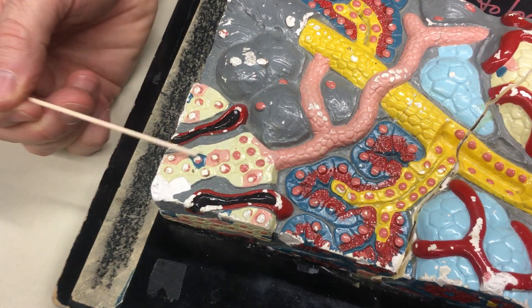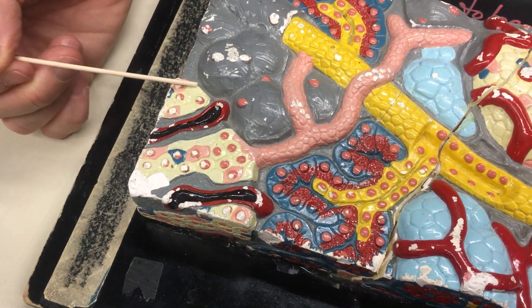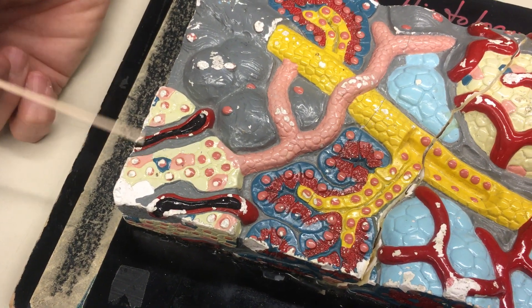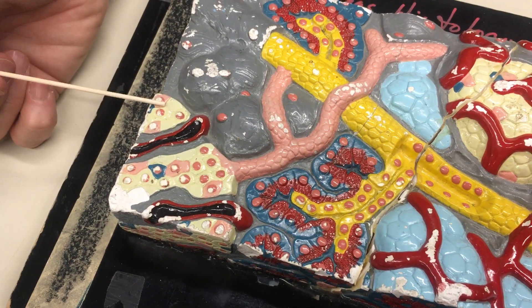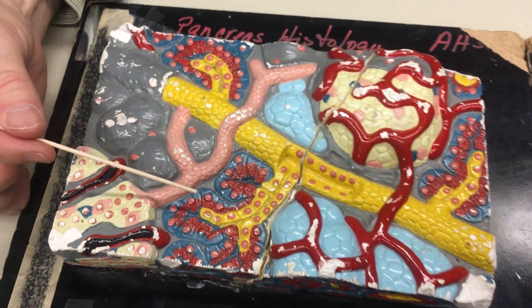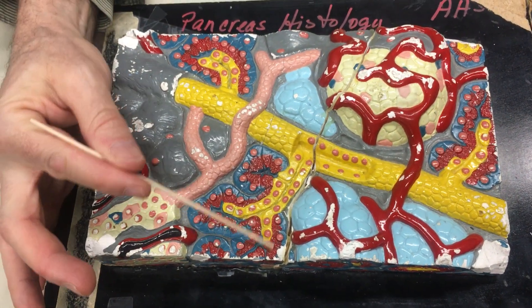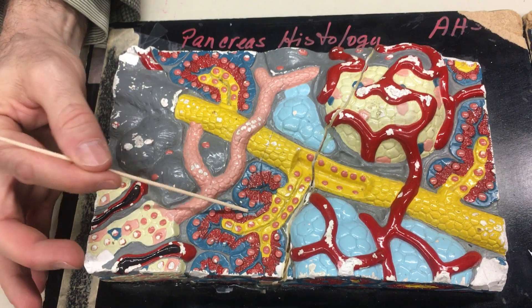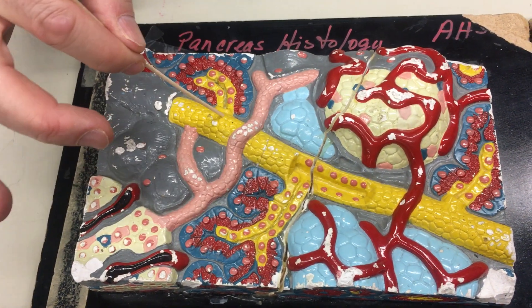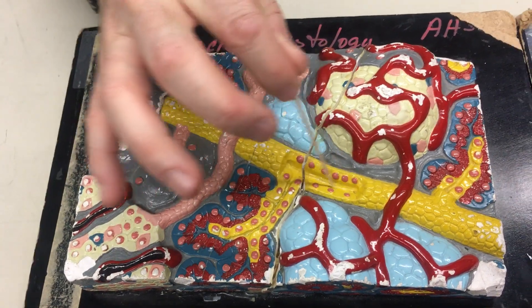The yellow beta cells make insulin, and the pink alpha cells make glucagon. The exocrine portion — shown in red and blue — consists of the acini cells. They surround the pancreatic duct and make enzymes for digestion.